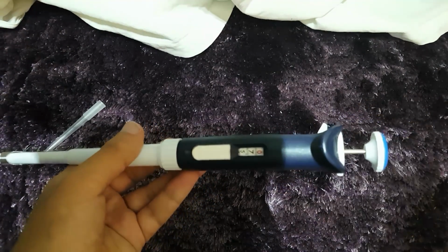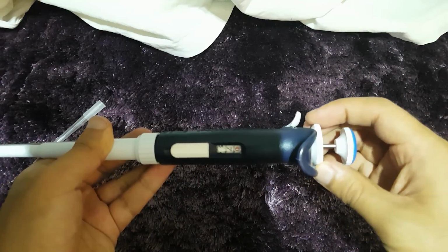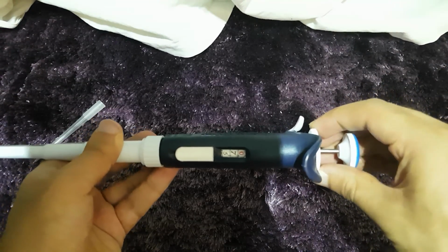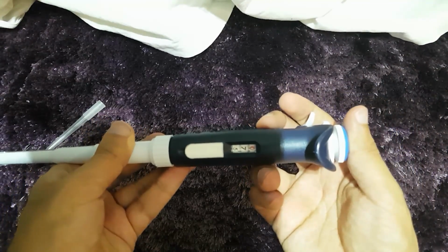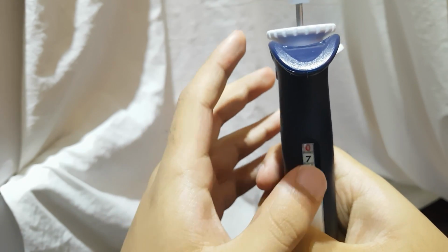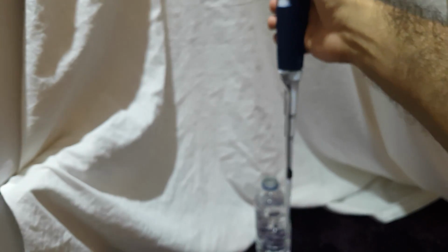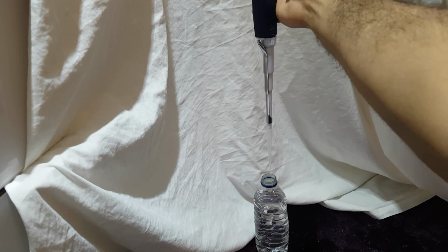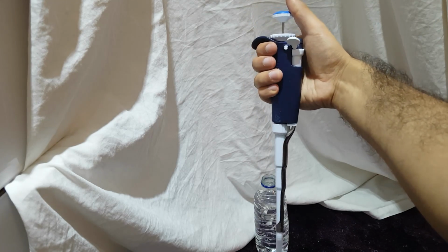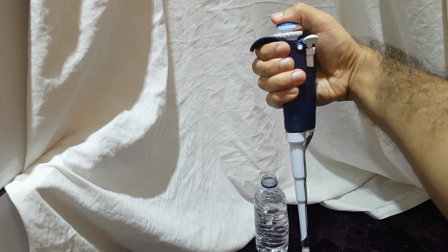So, again, just to recap, I hope you remember how to use a pipette. Pull this up here to adjust the volume. So let's say we do 750 microliters. You push this back down here. Check it works. We are going to choose 750 microliters. So just make sure we're exactly on 750. Push this back down. And before we go into liquid, we will push this down to the first click, not the second click, the first click, as you can see here.